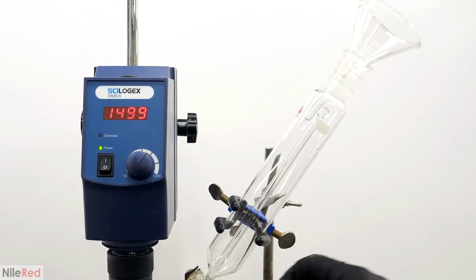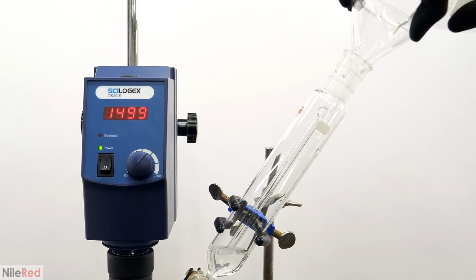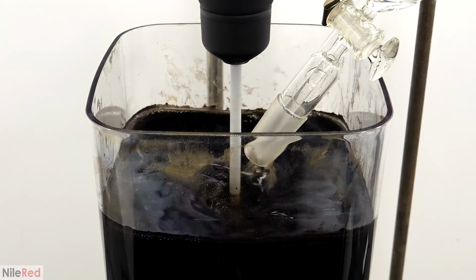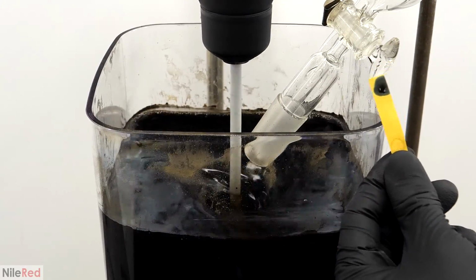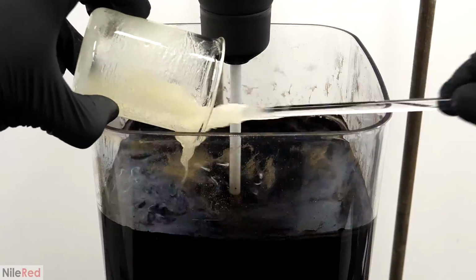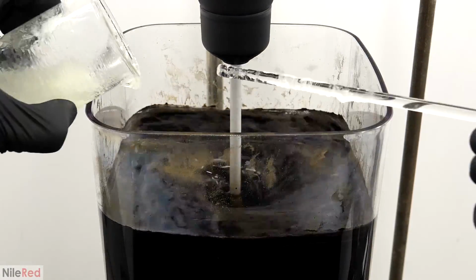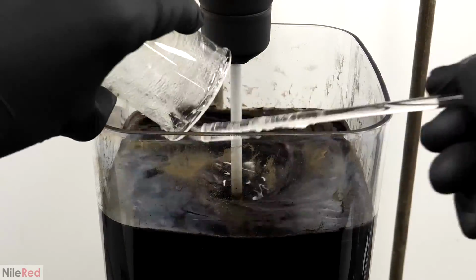When it had almost just been 15 minutes, I went back to the reaction and I filled the addition funnel with 15 grams more of the concentrated ammonia. All of this ammonia was quickly added within about a minute. And when it was done, I checked the pH and I saw that it was nice and basic, probably just below 10. I then took away the funnel and I dumped in all of the soap that I had just made. It has a tendency to get stuck inside the beaker though, so to get it all out, I had to wash it a couple times with distilled water.